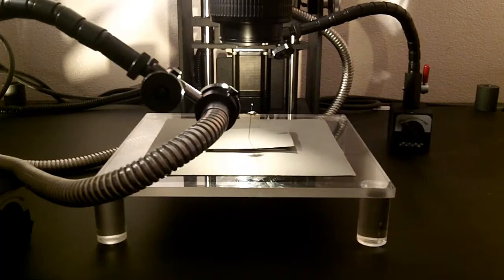Alright, so here we are with the light intensity increased and I really like this lighting composition. You can see on the histogram the exposure is directly in the middle which is what you usually want to go for when you're imaging biological specimens. You still get that great detail on the elytra but you get this nice even lighting on the specimen.